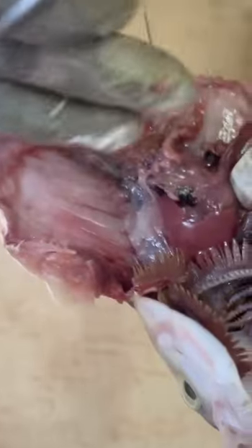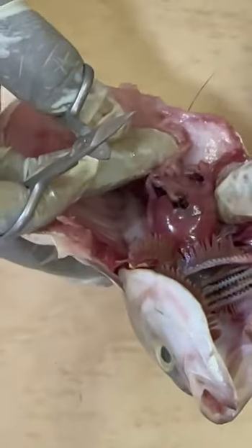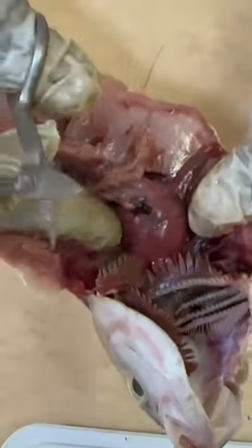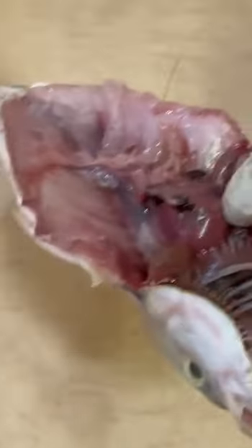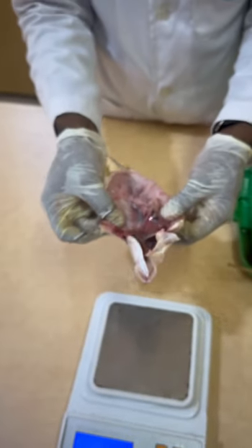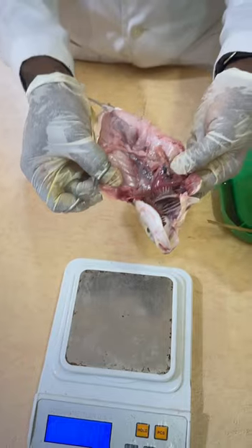You know, depending on when you work with different specimens. So what you see is that if it's a female, it will have two sacs, one on this side, another one on the other side. And these sacs, you will take note of the stage, the color, to know which stage of development it is. Now, for a fish like this, don't be surprised. It could just be at the stage of immaturity, or at the stage of spent, or at the stage of recovery.